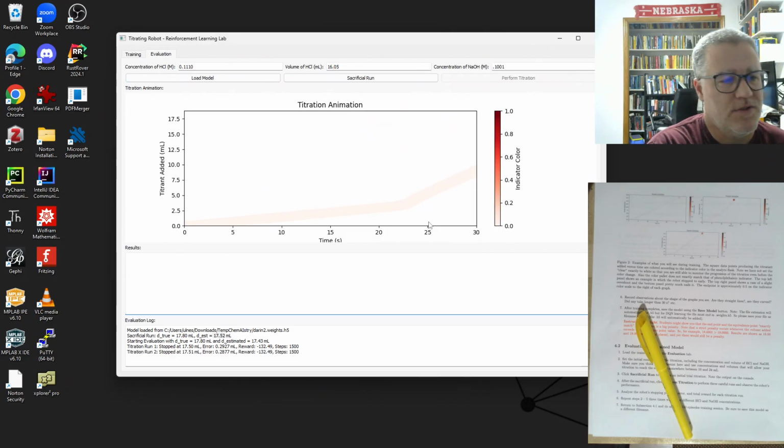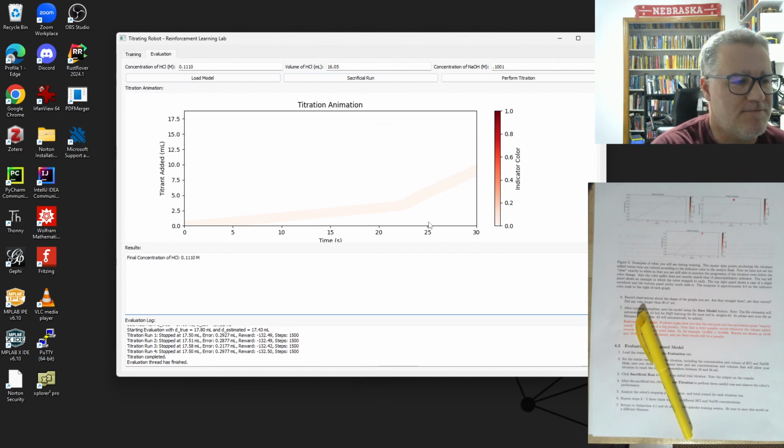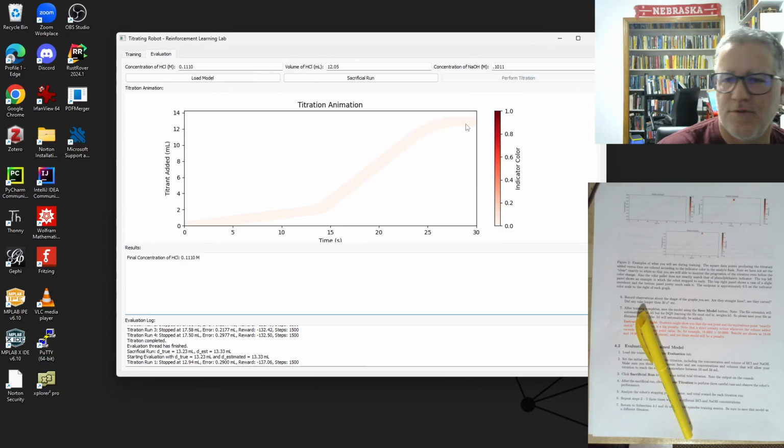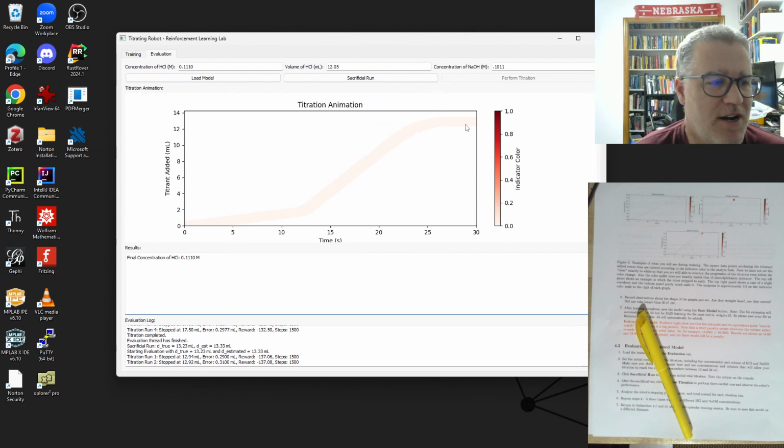Oh, okay. So that training error at the very end that we saw there seems to have been a bit devastating for this. I'll just change these numbers a little bit, but I'm guessing we'll still have some problems. Yeah, we're running off the edge. So this is a good example of where it failed to train well.